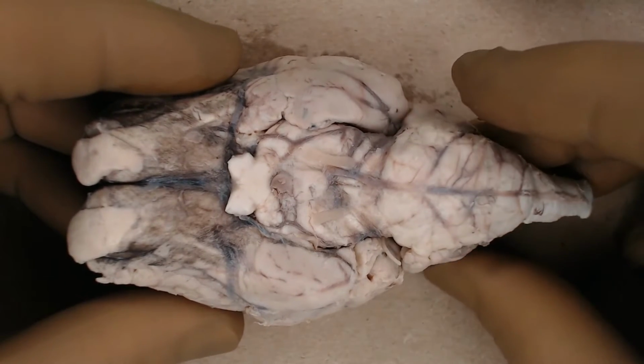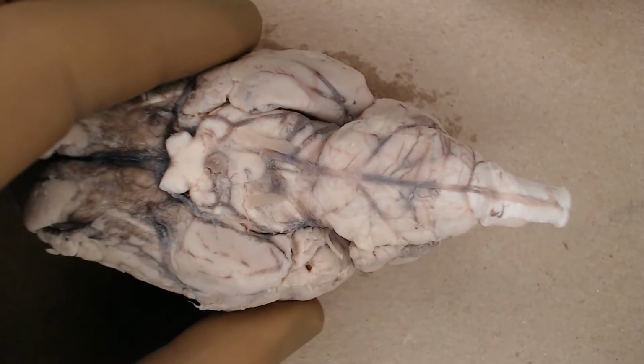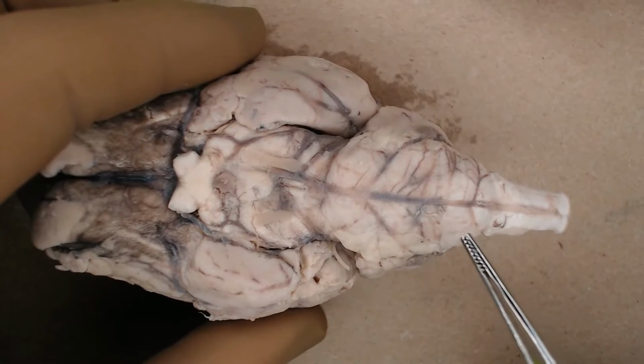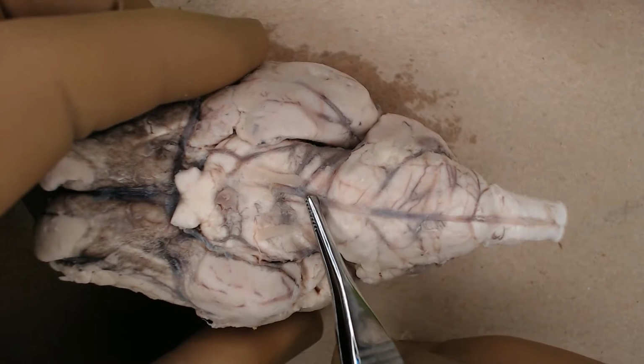At this point, you should have been able to find much of your brain's vasculature. Now, all the brains are different, so it might not have been possible to see everything, but usually you've got some residual blood in the vessels, staining them darker than the surrounding tissue. So you can see things like this midline basilar artery, right?